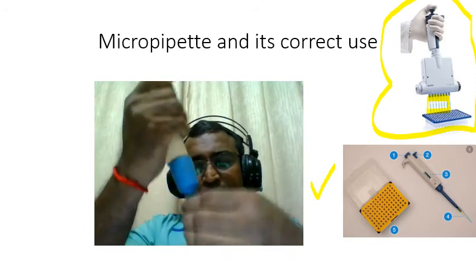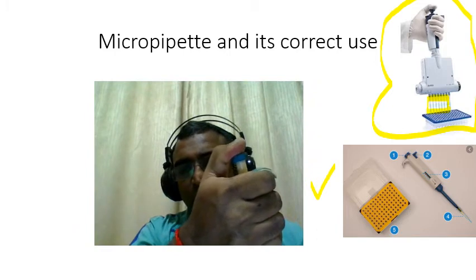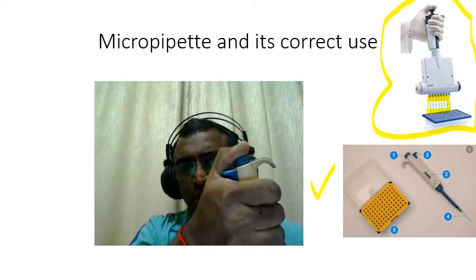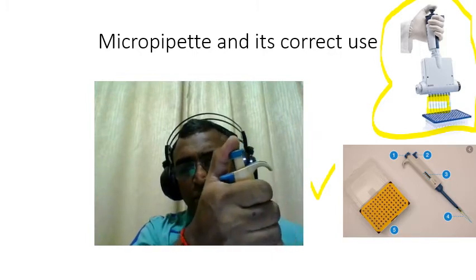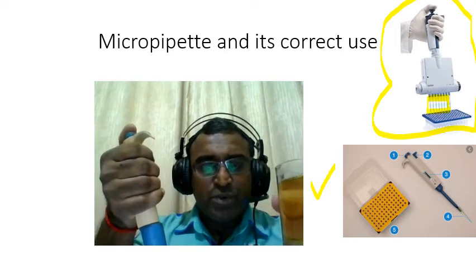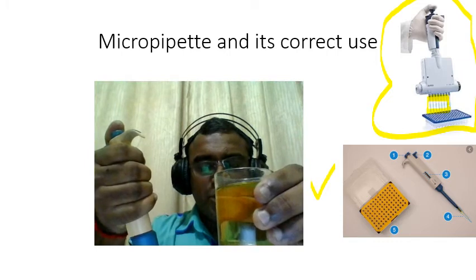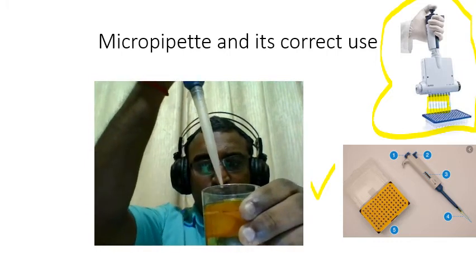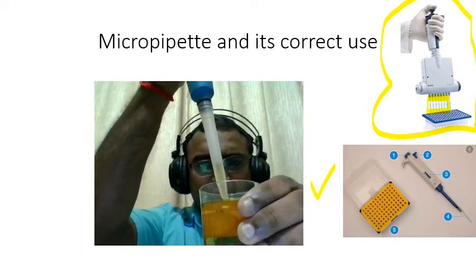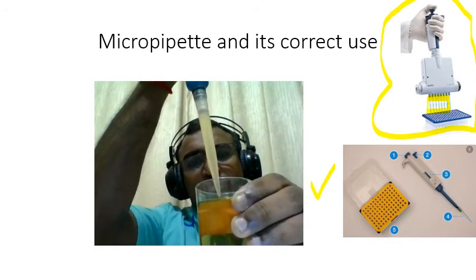Okay. So next thing, the proper use of the micropipette. You then press here until you feel resistance. Actually, when you achieve the resistance, you can press further. But when you do the suction, you just press up to the first resistance, okay? And then I have here a colored solution to demonstrate how to take up. While you are at the first resistance, apply the pressure. Do not release it at any point. Go to the solution and then do the suction slowly until it has reached a stable volume, and therefore that is 4.5 ml.